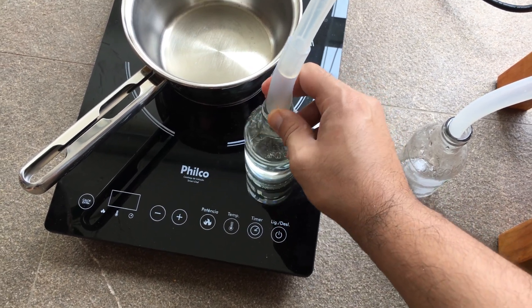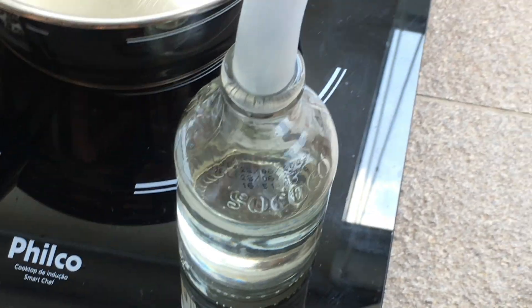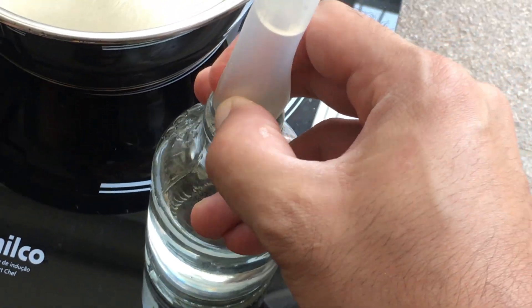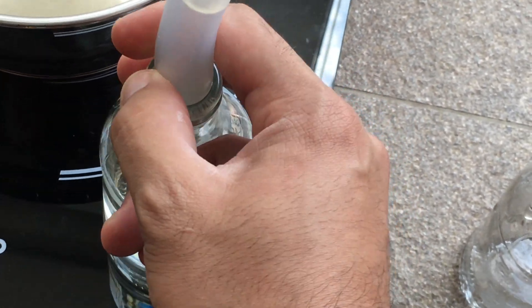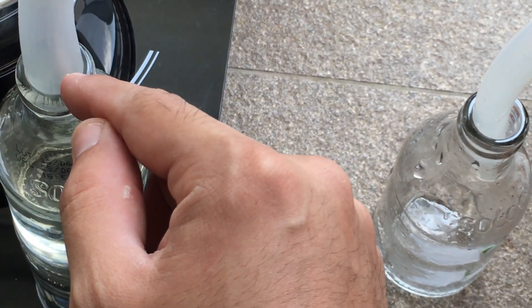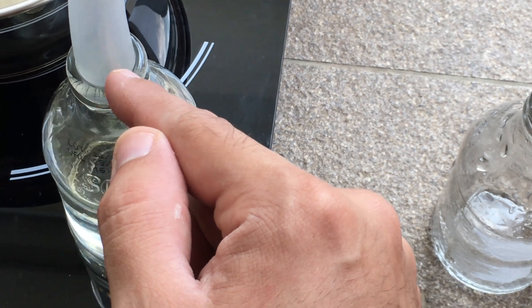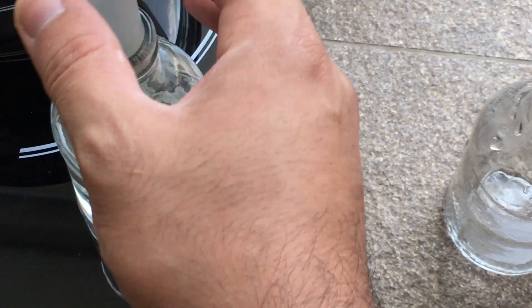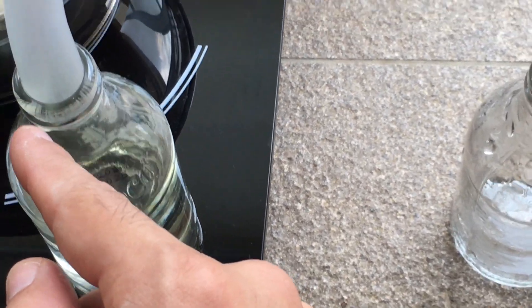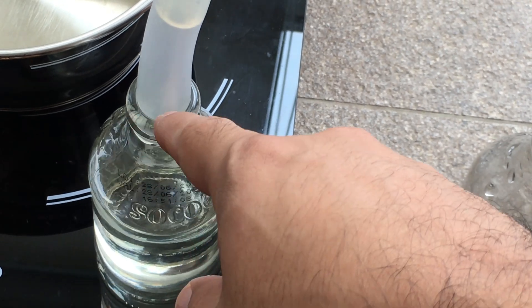There will be some losses, but you can put silicone around the necks. I don't have any more silicone tubing since they all dried out, but you can just push it in a bit and it'll stay pretty airtight.